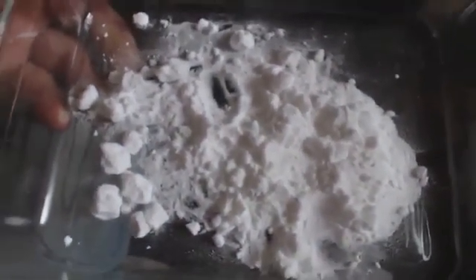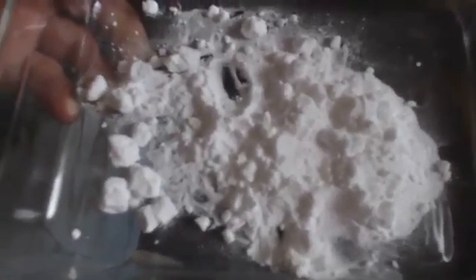I'm using Fahrenheit instead of Celsius like I usually do because ovens in America work on Fahrenheit. So I'm going to put it in at 400 degrees Fahrenheit.